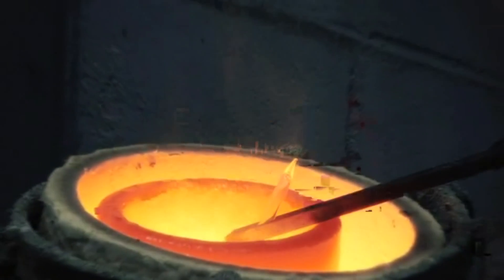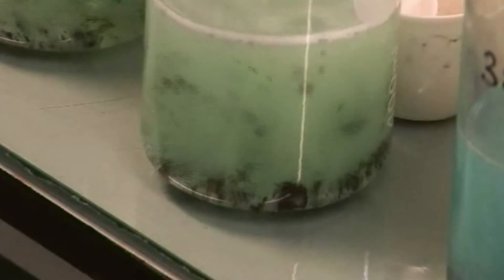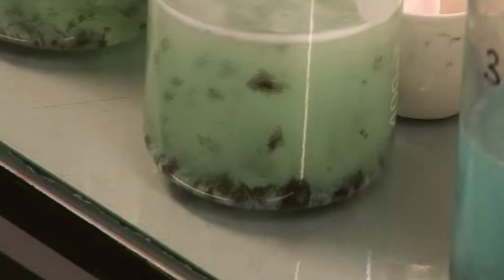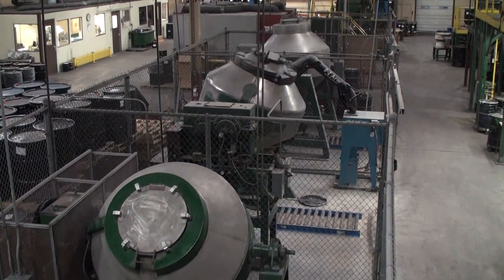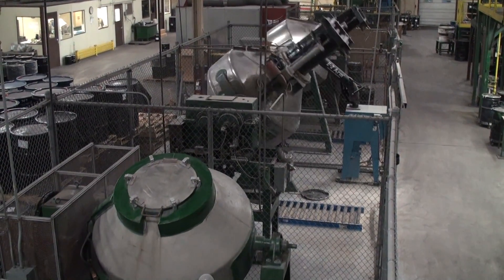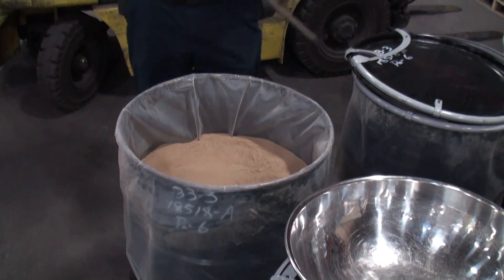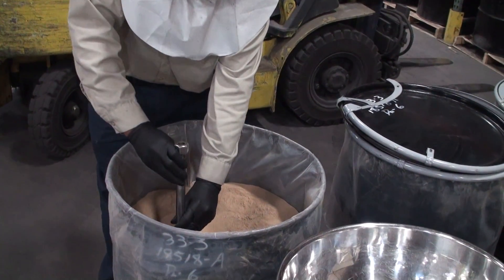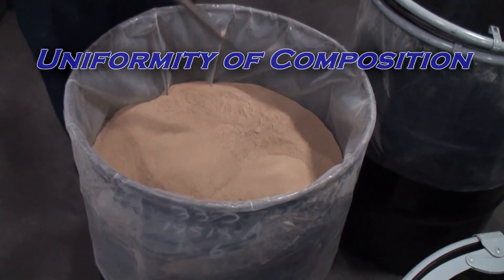For example, scrap metal lots are melted to form alloys or leached to take all the metals into solution for analysis. When the bulk contains solid particles, homogenization or mechanical mixing is the sampling technique employed to create a uniform distribution of particles so that each sample taken from the mix will represent the average composition.